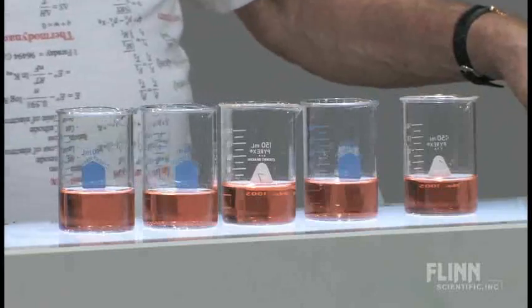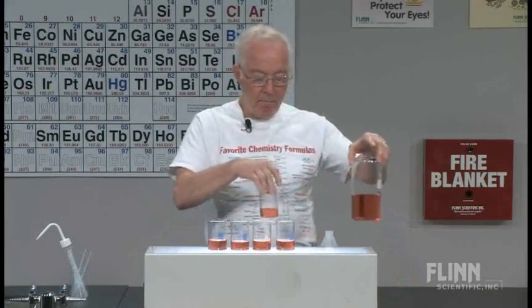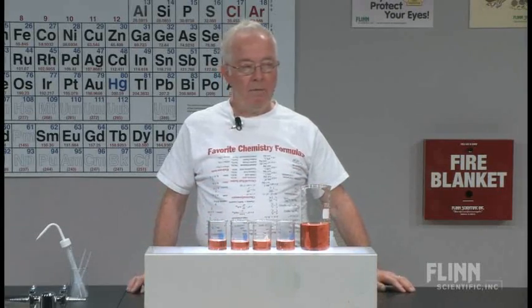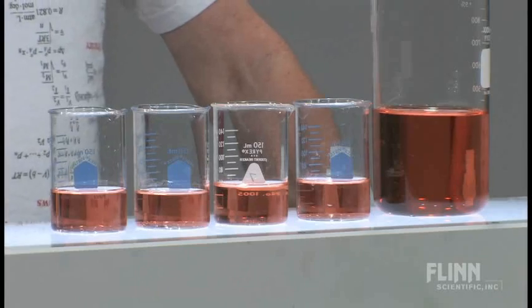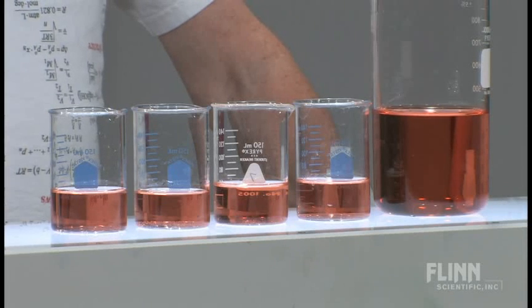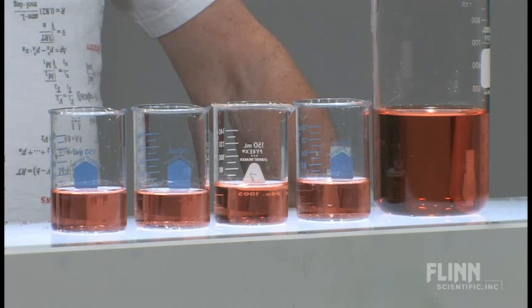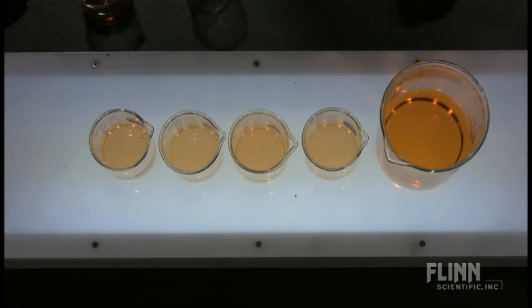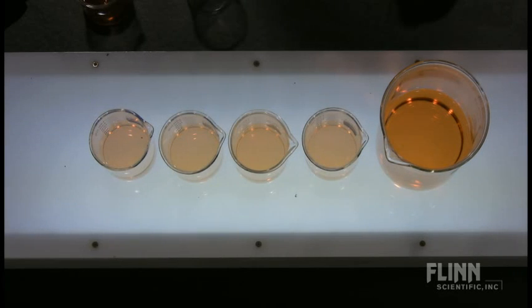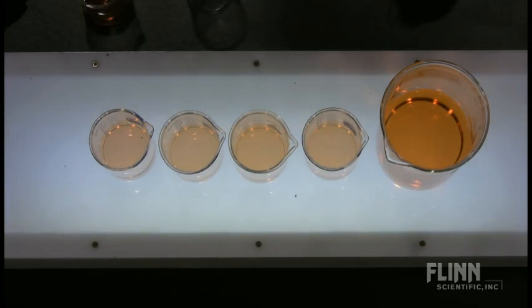Now I'm going to add one more beaker into the mix — I'll replace one of them. If you look horizontally, I would assume that the large beaker is darker in color. If you look vertically on the overhead camera, I would assume the large beaker is darker.